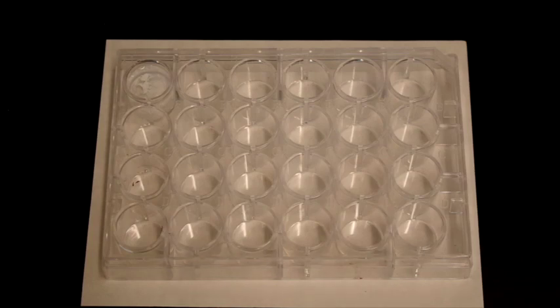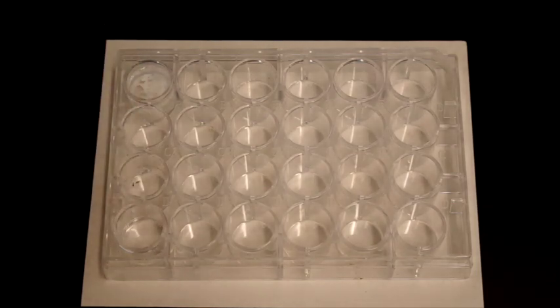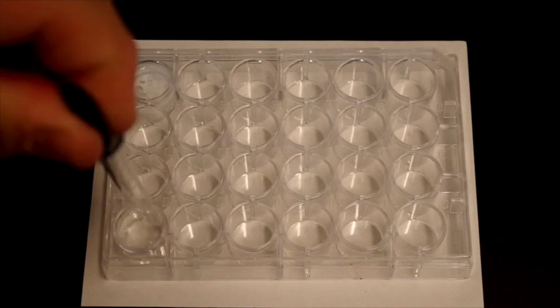The next one is silver nitrate and sodium sulfate. So here we have sodium sulfate. I'm going to add it to the bottom left corner of the spot plate, like so. Again, we're going to put 2 dropperfuls in just to make sure we have enough volume.